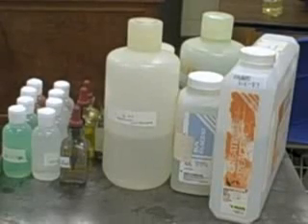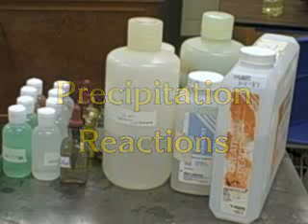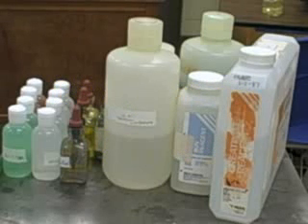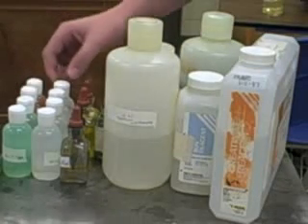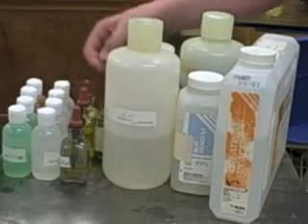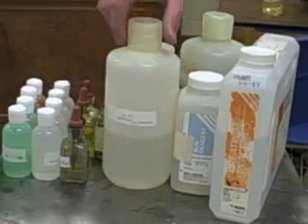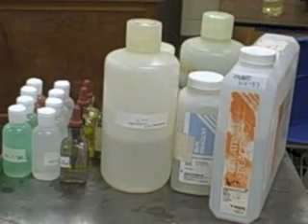So today we're going to be doing some precipitation reactions, and basically a precipitation reaction is when two soluble reactants come together to make an insoluble product and a soluble product, which is the byproduct there. And so we're going to be precipitating all kinds of stuff today. We've got iron chloride, nickel chloride, sodium chloride, sodium phosphate, potassium chromate, silver nitrate, potassium iodide, sodium carbonate, lead nitrate, copper sulfate, and sodium hydroxide.